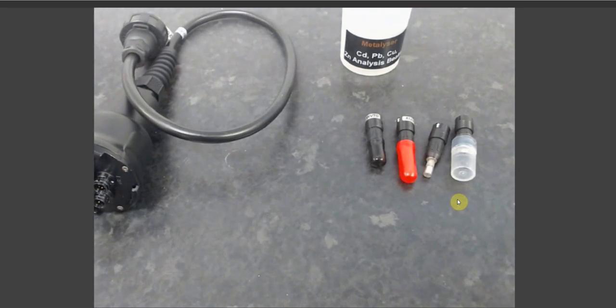There is a WE3 electrode as well for the last slot. This, as a rule, is only for tests and parameters supplied with the HM3000 upgrade kits and not the base unit that you will have received.